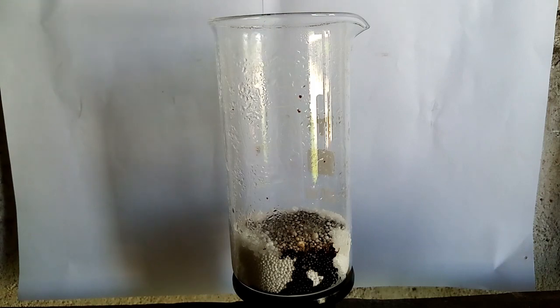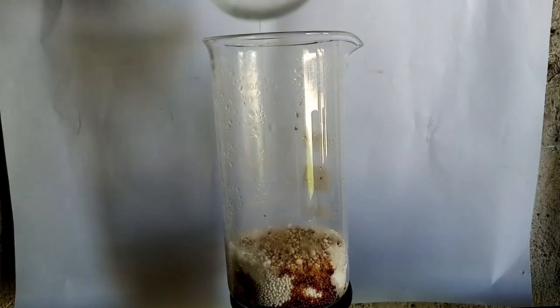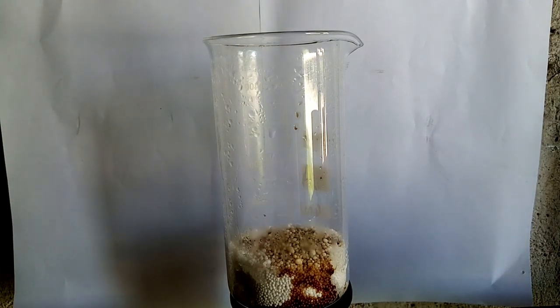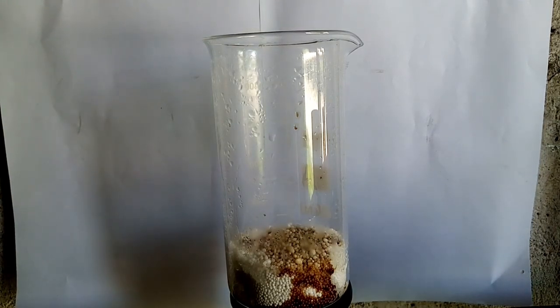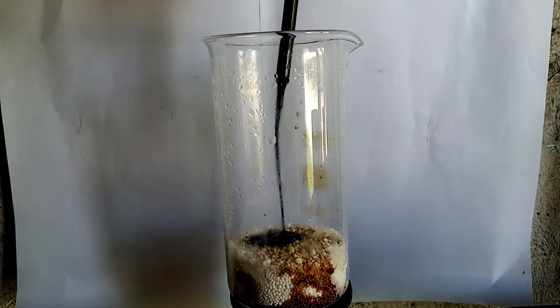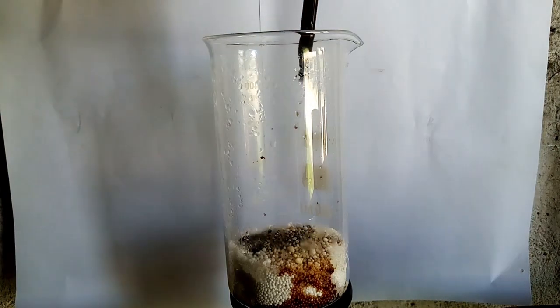At the first phase I pour the acid with a pipette and I see not really much is happening. I use the boiling flask with cold water to reflux all of the vapor that might escape from the beaker.